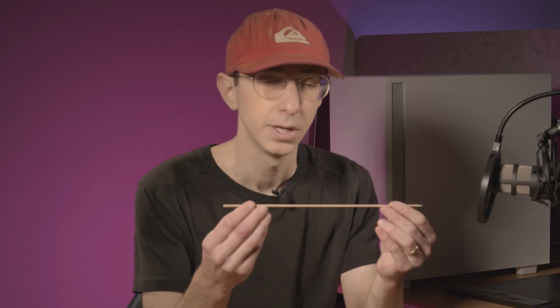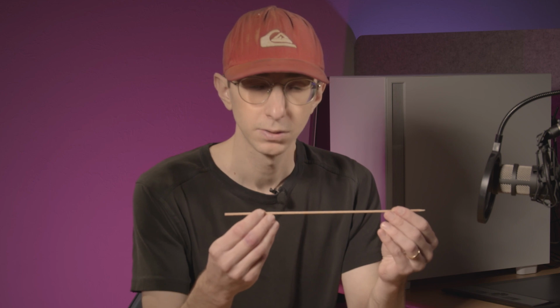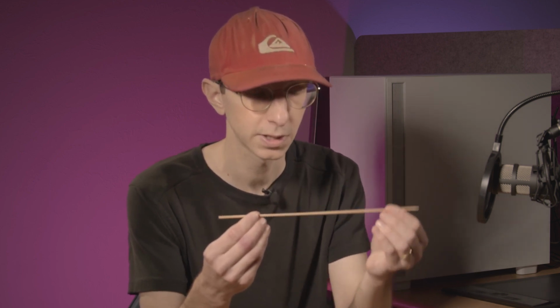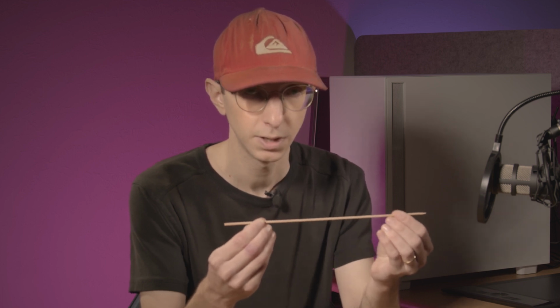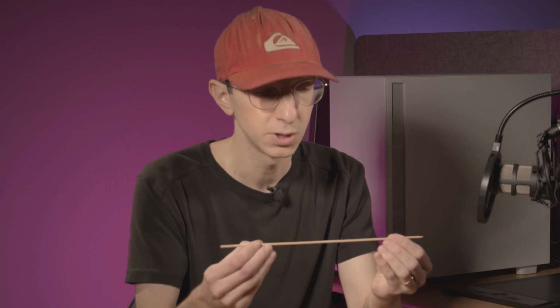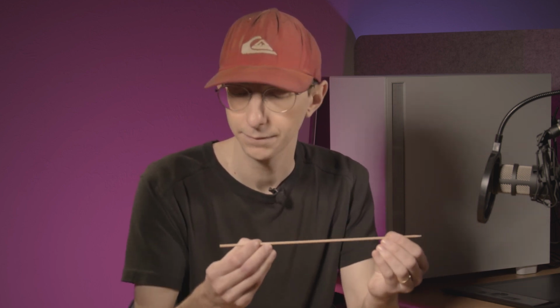let's imagine that this barbecue skewer is a laser beam. It has some orientation in space. I can move it up and down and left and right, and I can also completely move the beam, offset its position up and down and left and right.